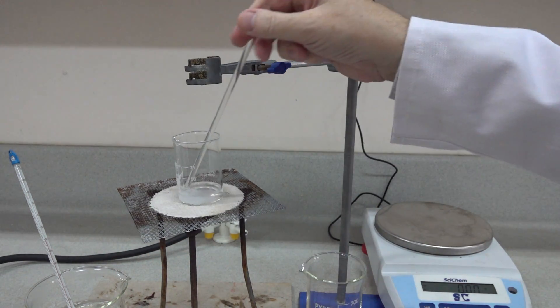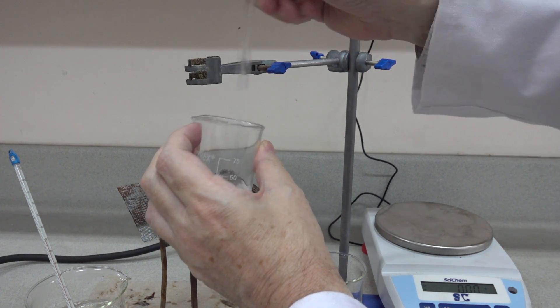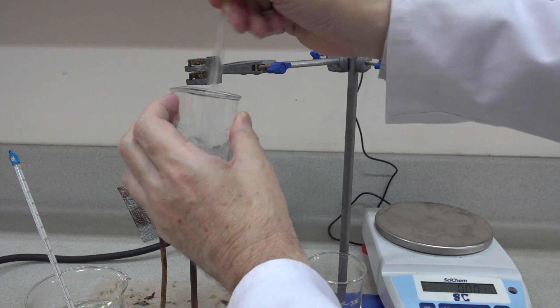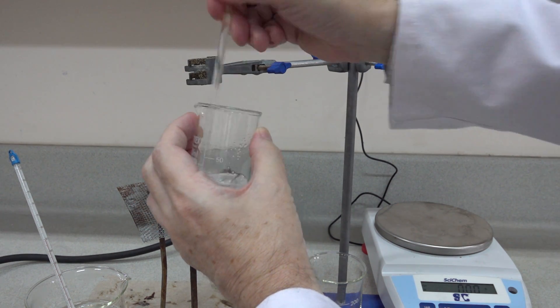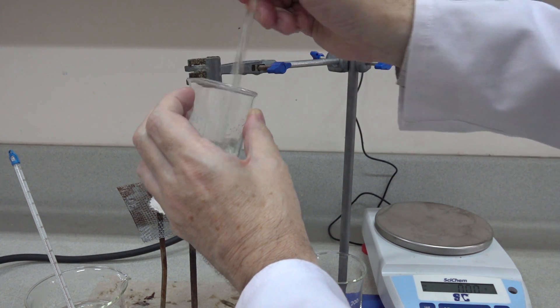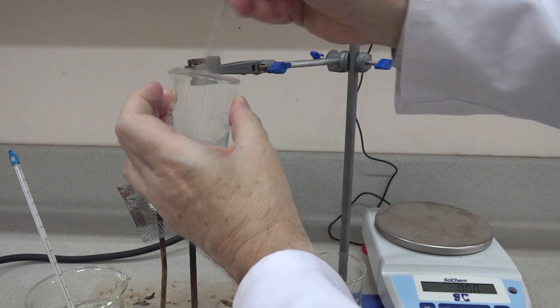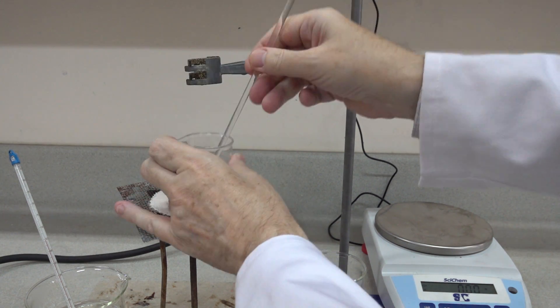Let's take quite a bit of solid even with rapid stirring. And of course we don't know the temperature yet of the water but we know that it started at around 50. It will be cooling due to the effect of the glassware, the stirring rod, and the potassium nitrate that's dissolving. So just one more measure there and we've got a fairly concentrated if not saturated solution of potassium nitrate.